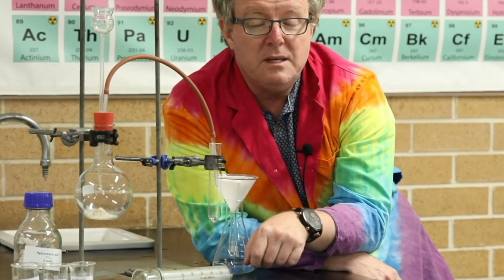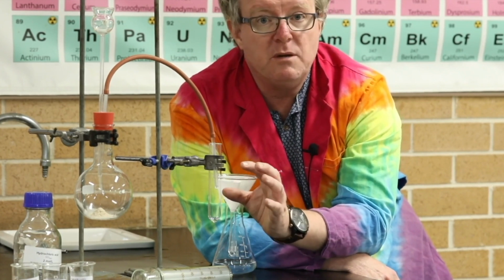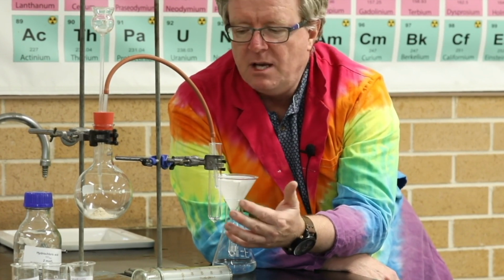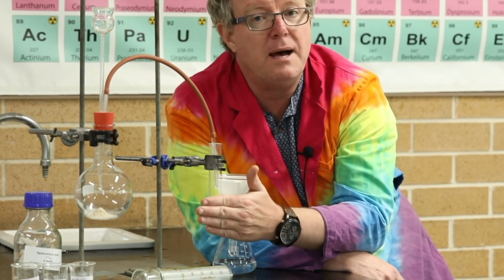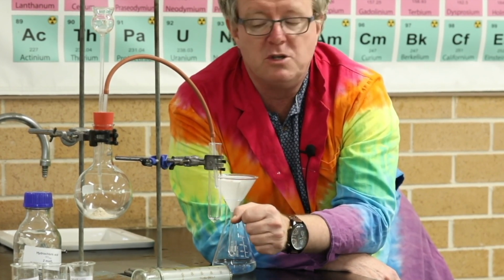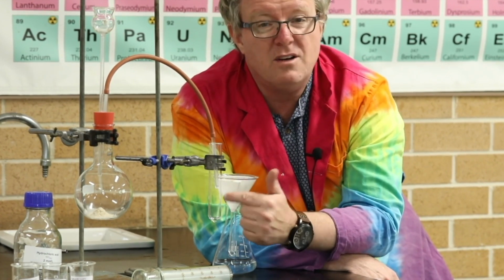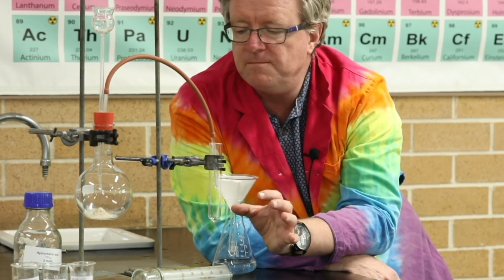Here we are in the practical to do with acid on carbonates. And with this experiment, what we're going to be doing is taking it one step further than you probably did in year 10. We're going to look at a variety of carbonates here, and we can investigate, does the type of carbonate affect the rate of CO2 production? That's one possible experiment you could do. We could do it just by measuring with our eyes in terms of the rate of bubbles being produced, and we can do it more quantitatively as well.